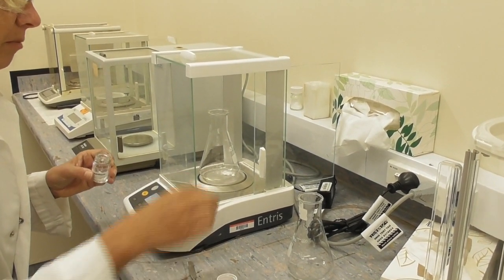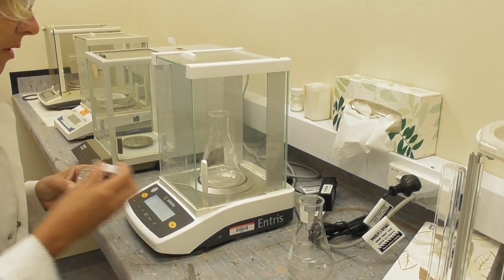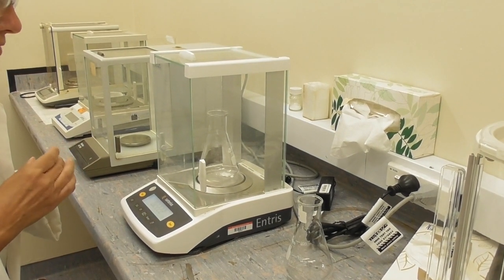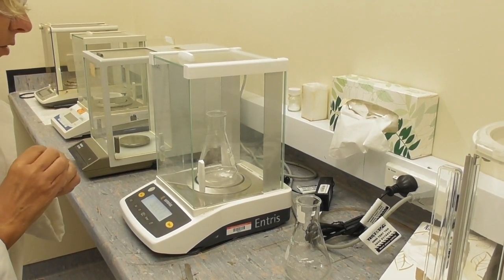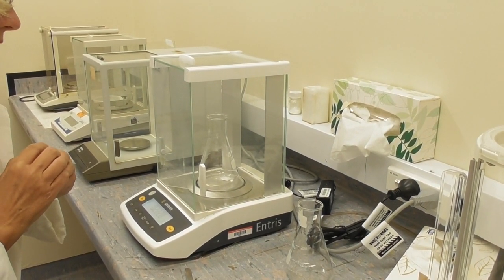In this case I'm a little bit above the desired range, but as I said it doesn't really matter. I have 0.2220 grams in my flask.